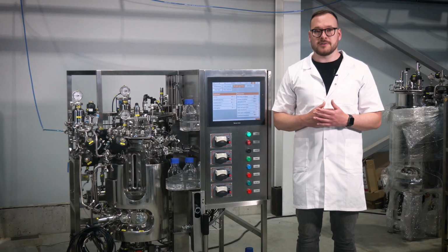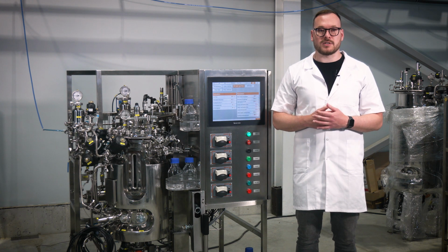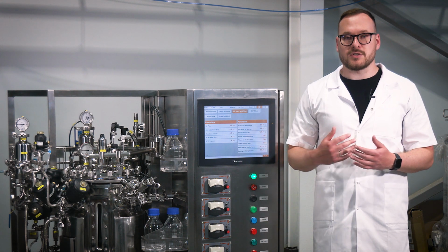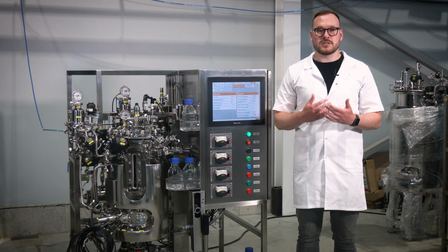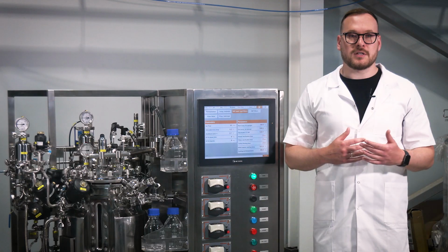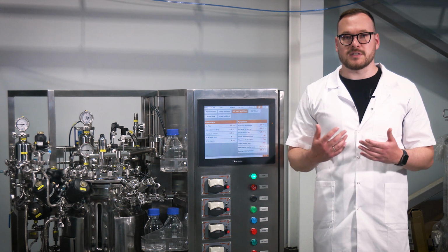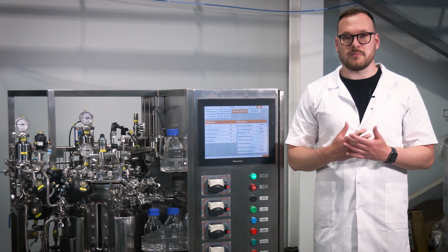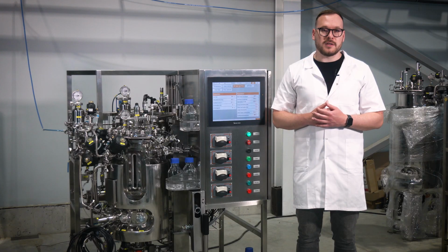Check for condensate in the pressure reducers on the air and oxygen line and drain if condensate is present. Verify the power supply cable connection. Check if the temperature and other sensors are connected to the control cabinet. Prepare the pH, optical density, and dissolved oxygen sensors for operation as per the manufacturer's user manual. Check the hermeticity of the vessel, including the lid, the vessel body, valves, and pipelines, at an air pressure of about 1.3 bar.